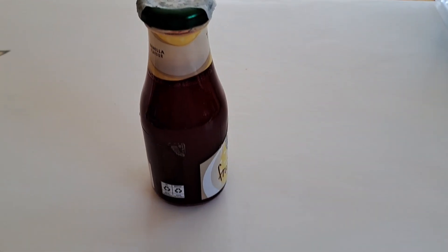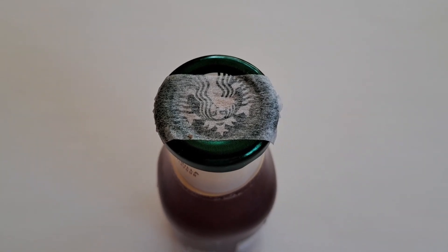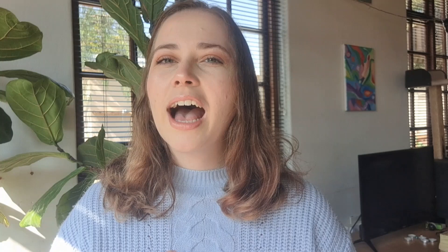I will use a knife to stab a hole in the bottle — don't make it too big, it's just for gas exchange so there isn't too much pressure buildup when you pressure cook it. After that I put some micropore tape over the hole to prevent any microbes from entering. Then I put aluminum foil over the top and secure it with a rubber band. I don't tighten the lid completely — just slightly open — to help prevent too much pressure from building up.